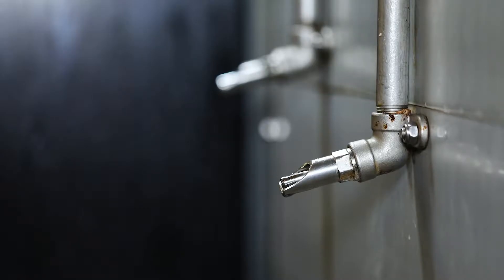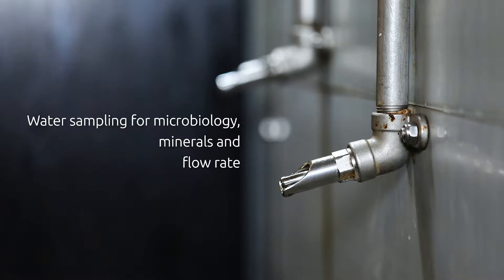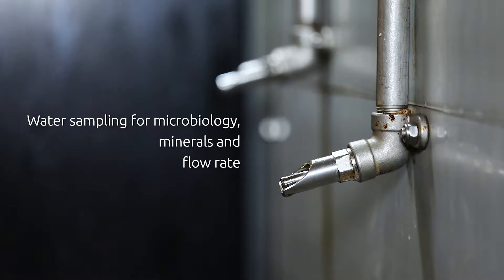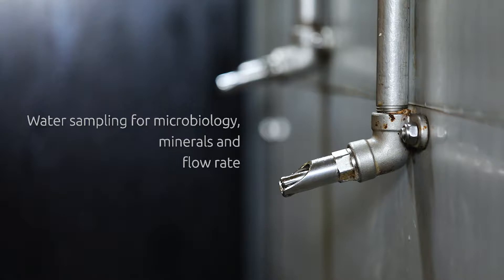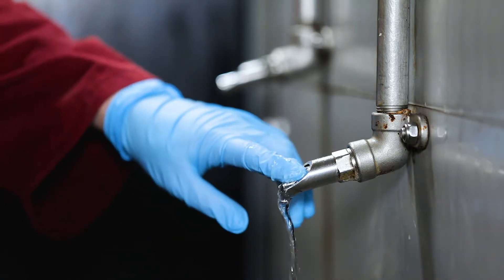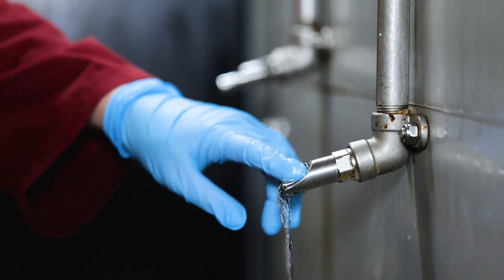Water sampling for microbiology, minerals and flow rate. In this video, we'll talk through the steps of taking a water sample for microbiology and mineral testing, as well as how to measure flow rate.